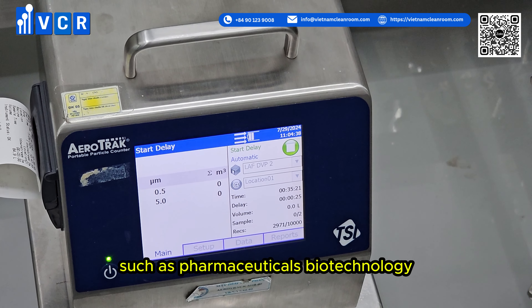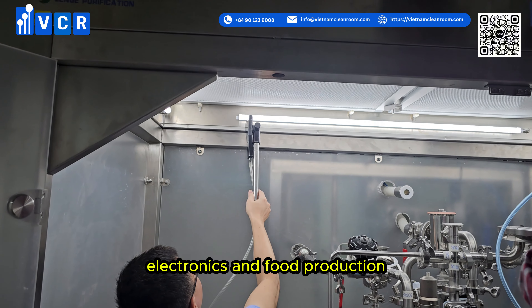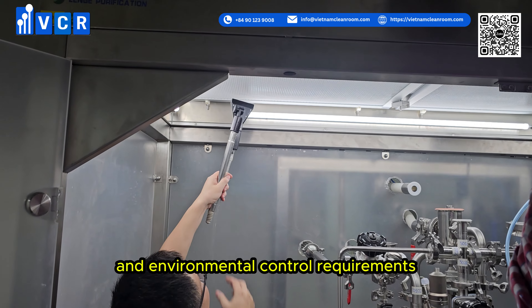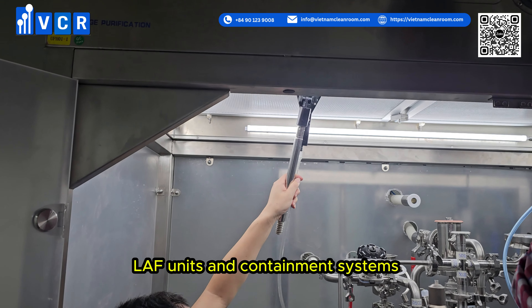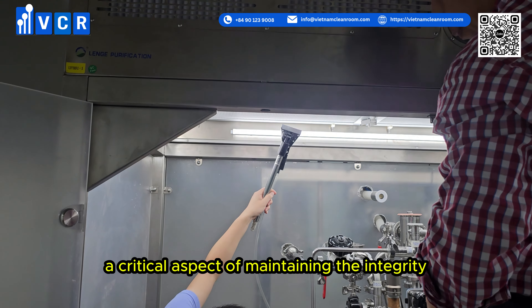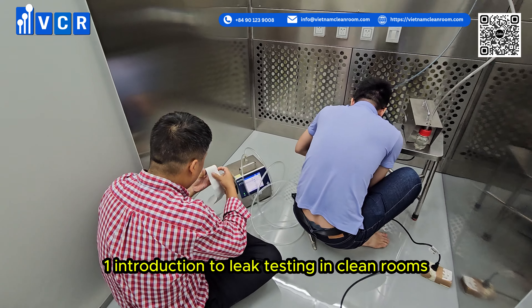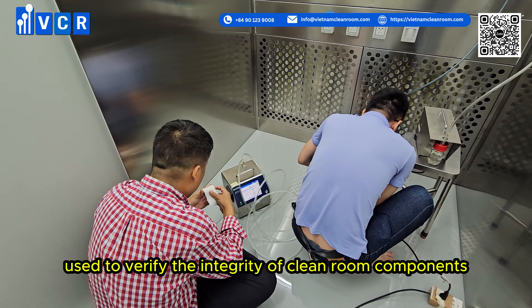Leak test for clean room equipment — ensuring integrity and compliance. Clean rooms play a vital role in industries such as pharmaceuticals, biotechnology, electronics, and food production. The stringent air quality and environmental control requirements for these industries necessitate the use of specialized equipment like HEPA filters, LAF units, and containment systems. A critical aspect of maintaining the integrity and functionality of clean room equipment is performing regular leak tests.